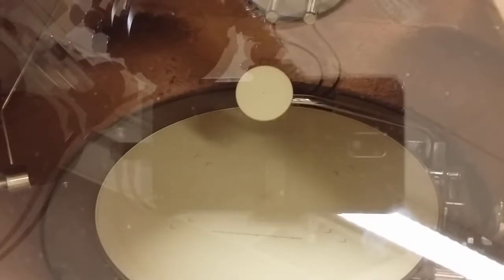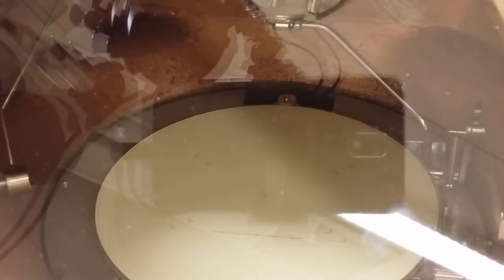So this is the viewing screen in the microscope. You can also see that there are two screens. One smaller dish atop of the bigger one. The smaller dish is used for the binocular view and the camera view in this setup. For the current demo session, we turn off the small dish. So now we only have the big dish exposed to the electron.